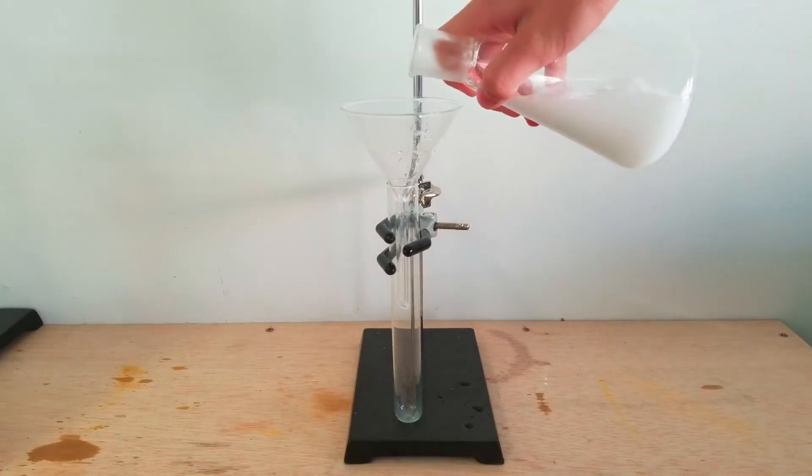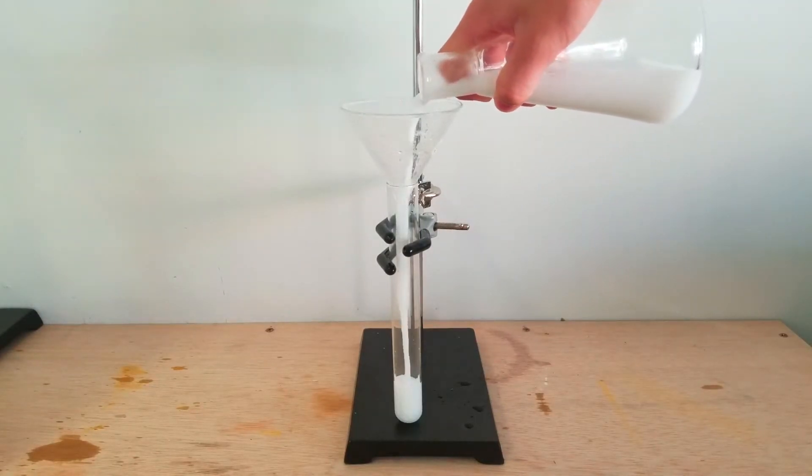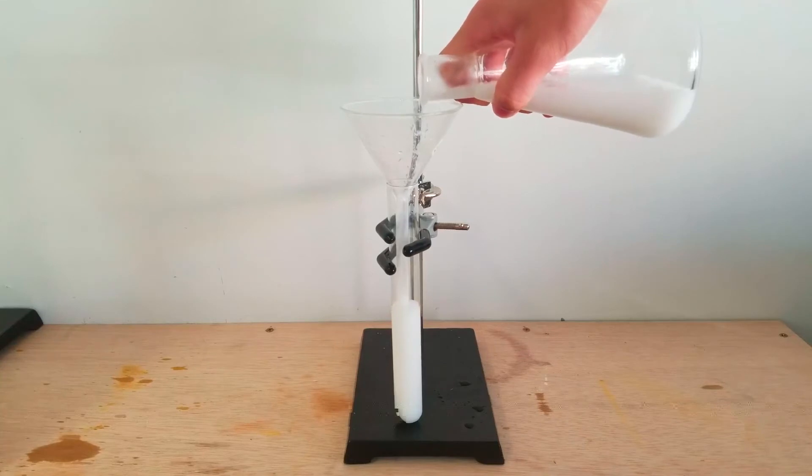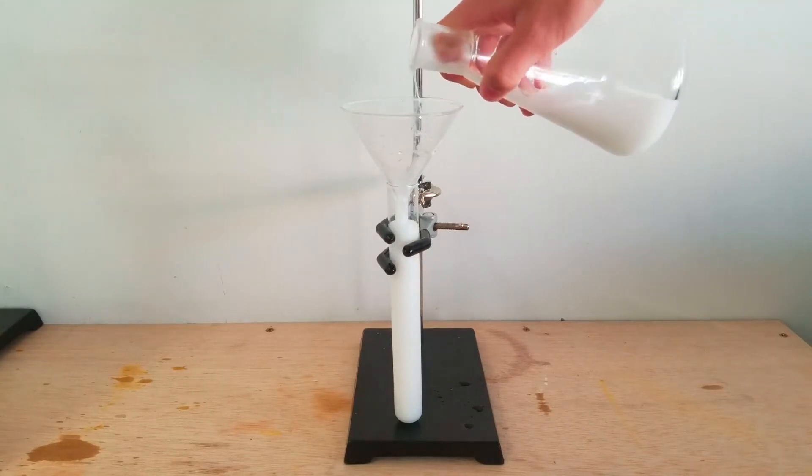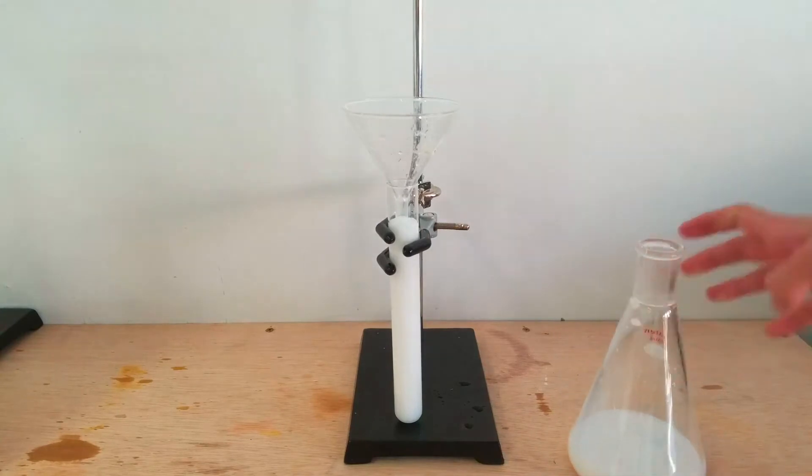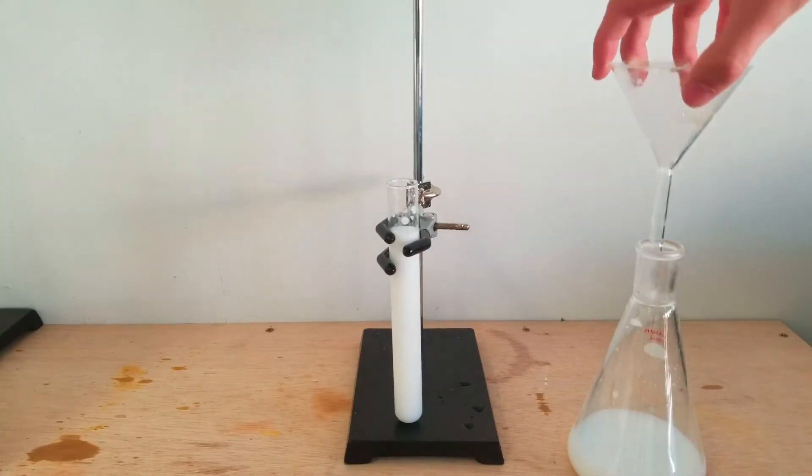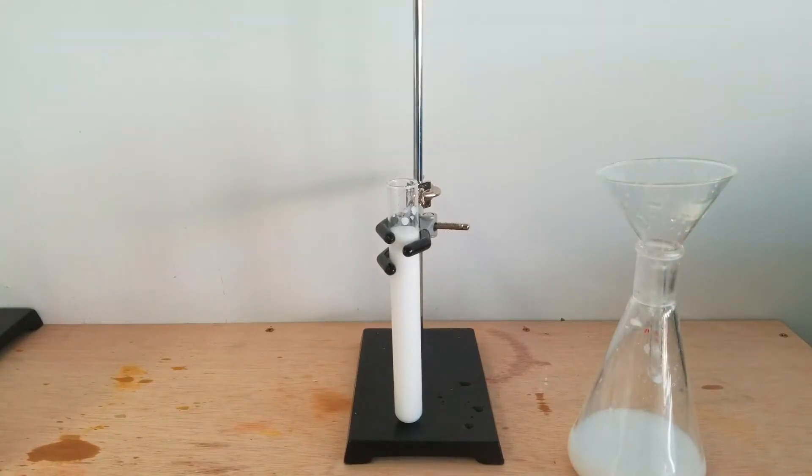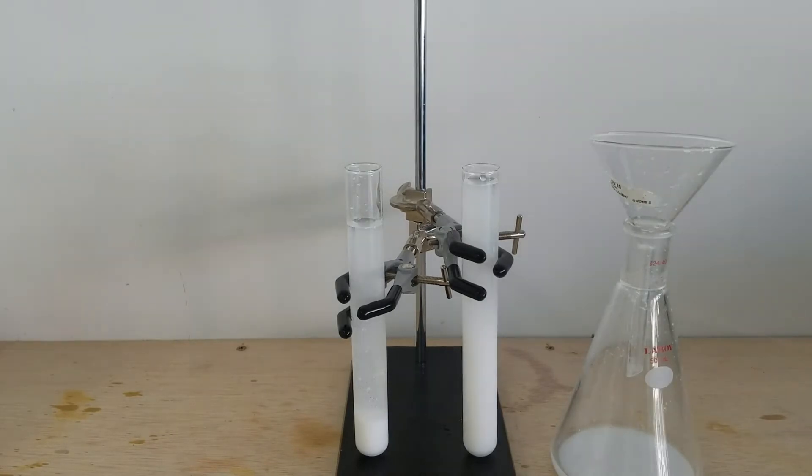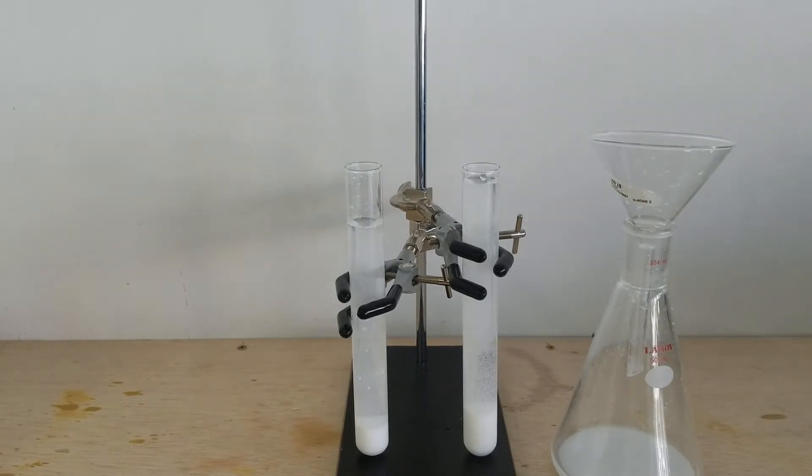After that, I was kind of stumped and I wasn't entirely sure how to decrease the volume of the mixture. I didn't really want to have to boil it off as I only have a heating mantle so that would be kind of difficult to get the solid product out of the round bottom flask. Thankfully though, I thought a simple solution would be to pour the remaining mixture into a long test tube and let it settle out and then decant it. I tried doing this, but the test tube was way too small and I had to use a second one. I then let it sit and decant as much as I could. I repeated this process until I had a relatively small amount of liquid I was honestly comfortable with waiting for it to evaporate. I transferred all the liquid to an evaporation tray and called it a day.